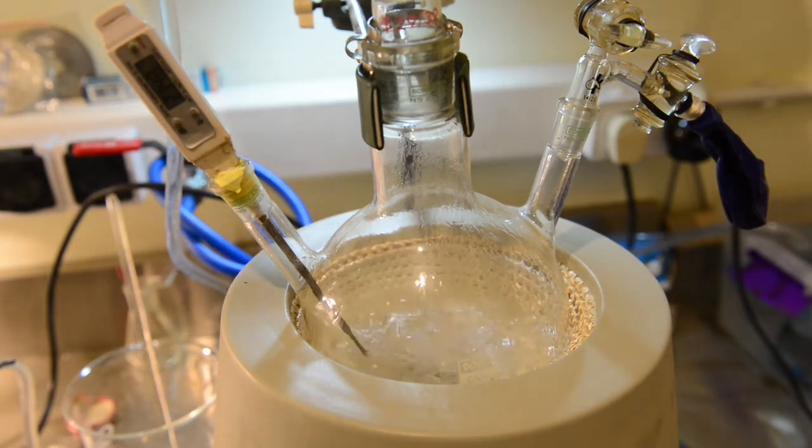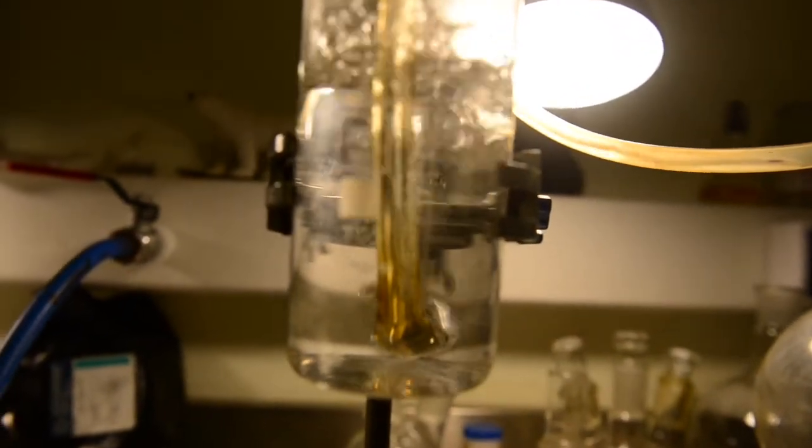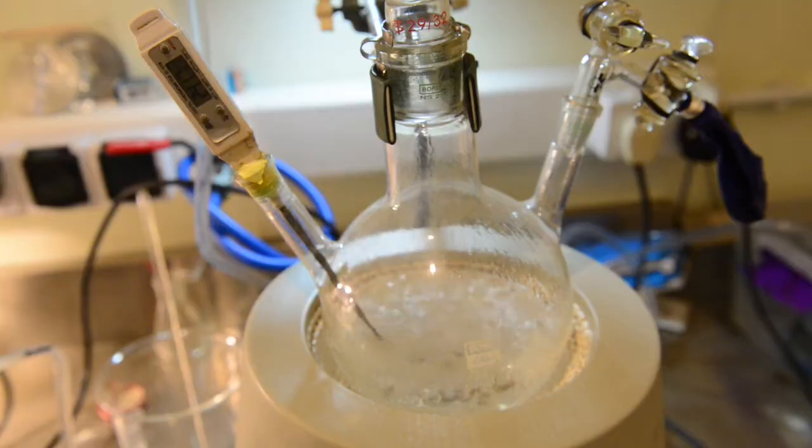The best advice to follow is the distillation rate. As soon as you get just one drop per 10 seconds, heating must be discontinued. It took 45, 50 minutes in my case. You can observe violent boiling and carbon dioxide evolution.